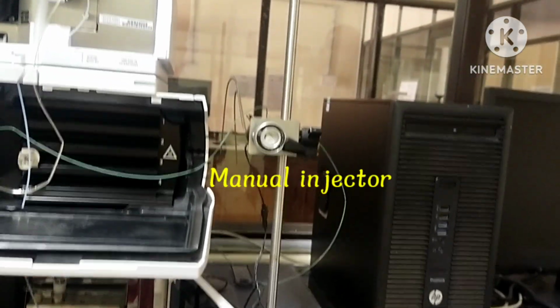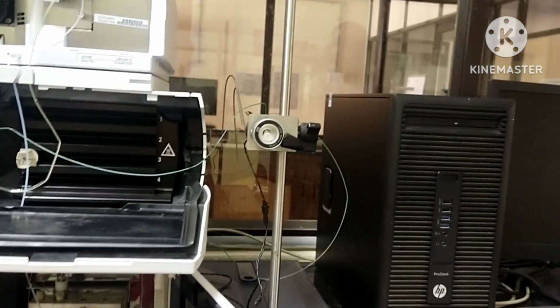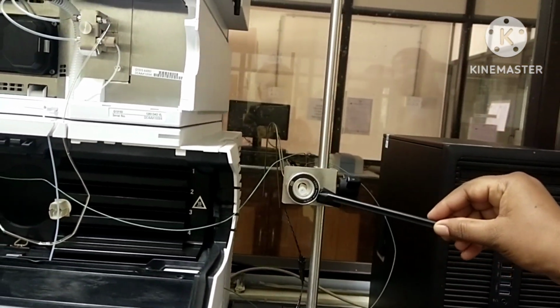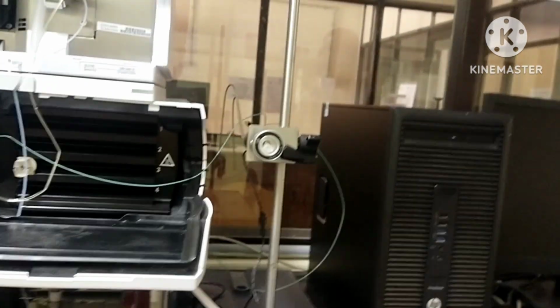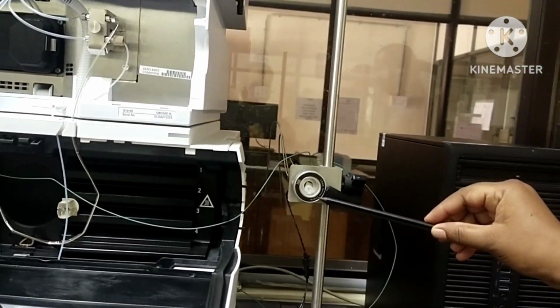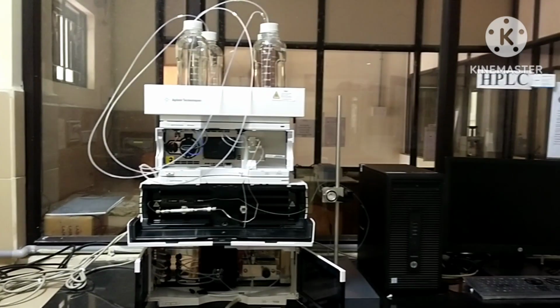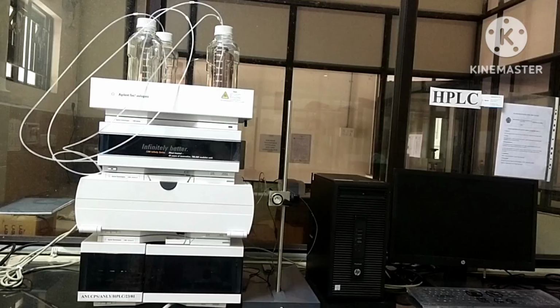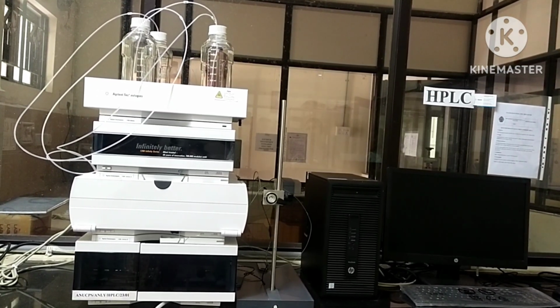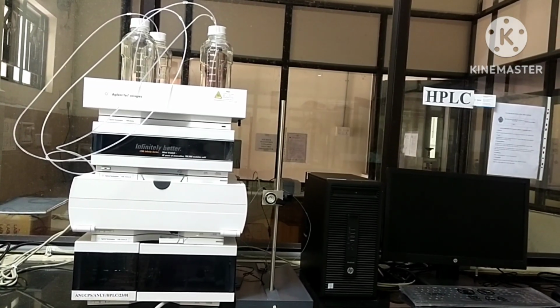It is a manual injector. Manual injection consists of a rotary valve, also called a Rheodyne injector, with two main positions, load position and inject position. When the valve is in the load position, the sample can be introduced in the system with a syringe. Sample is introduced using a microliter glass syringe. The entire HPLC system is connected to a PC. In Agilent 1260 Infinity HPLC, the software used is OpenLab software. This is the entire HPLC system.